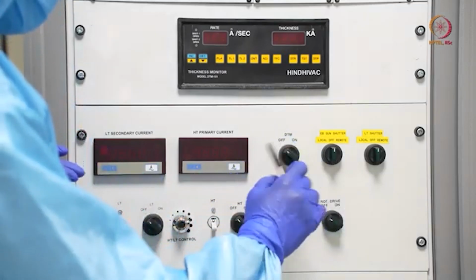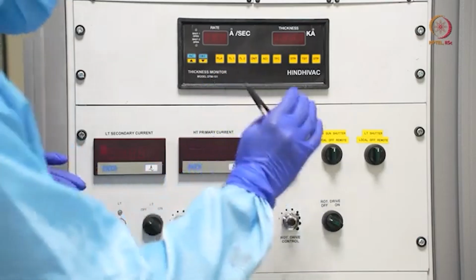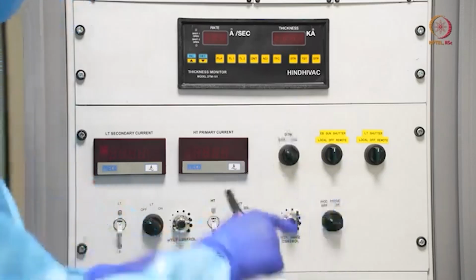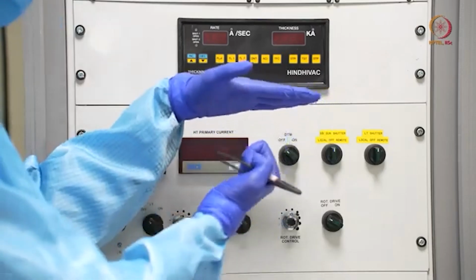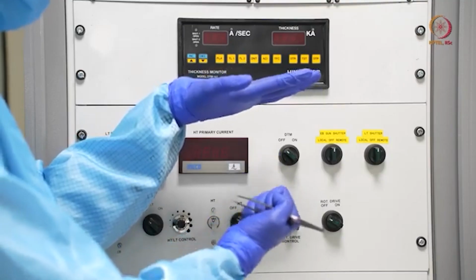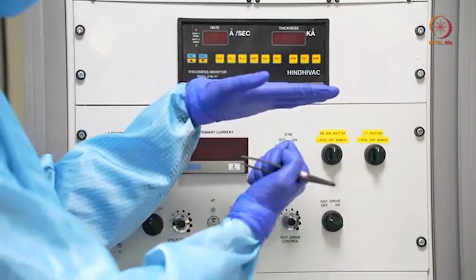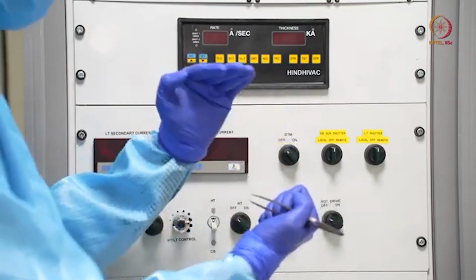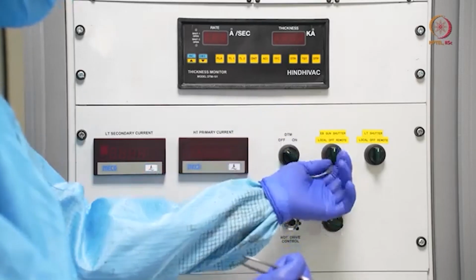So here, as you see, if we switch it on, then DTM will be on, and here this is the E-beam shutter. So the electron beam gun shutter is here. The shutter will stay closed as long as the material is not completely ready for deposition. It will melt, and we have optimized the recipe. As per the recipe, it will be ready for deposition at a steady rate. Till that time we have to wait. After that we can just open the shutter.